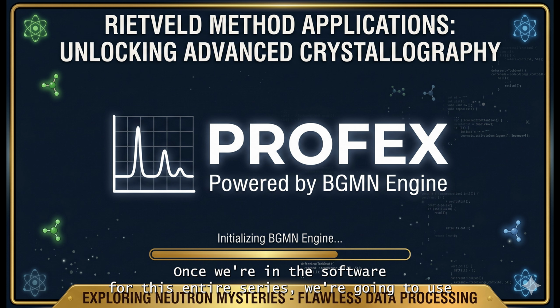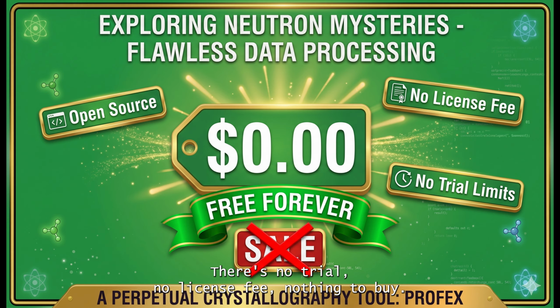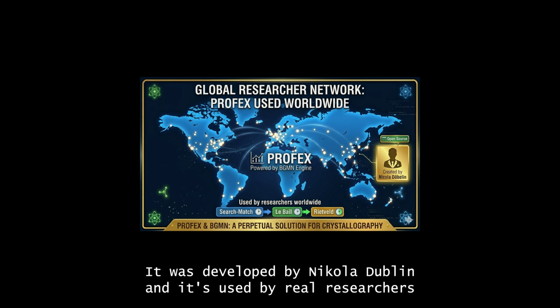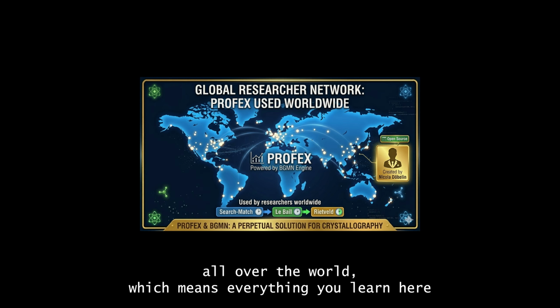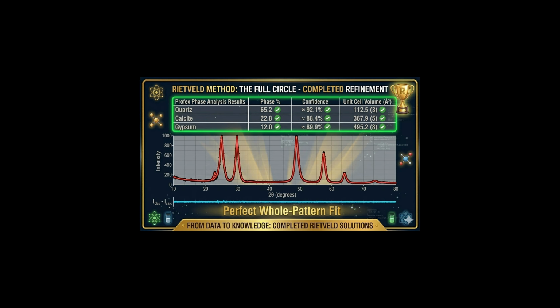For this entire series, we're going to use a program called Profex, paired with a refinement engine called BGMN. I want to mention upfront, this software is completely free and open source. There's no trial, no license fee, nothing to buy. It was developed by Nicola Döbelin, and it's used by real researchers all over the world, which means everything you learn here transfers directly to actual professional work.